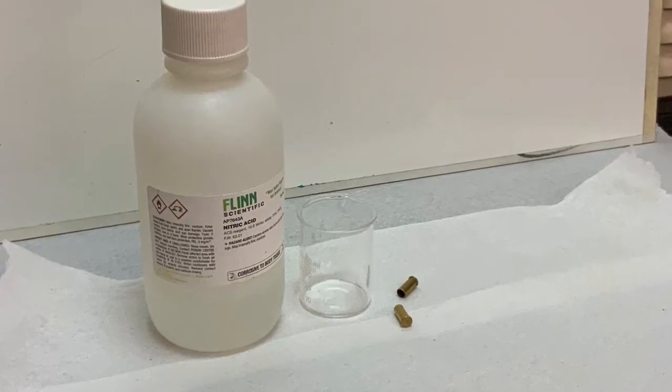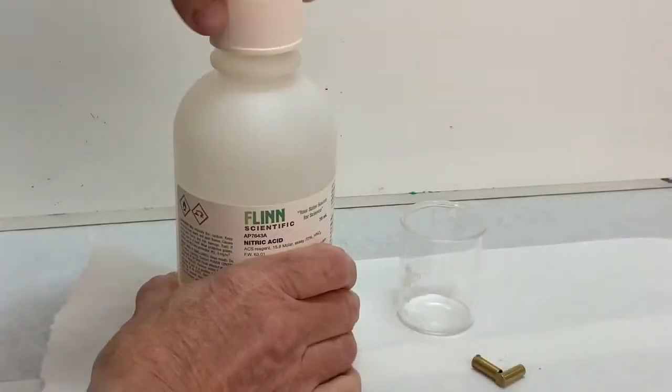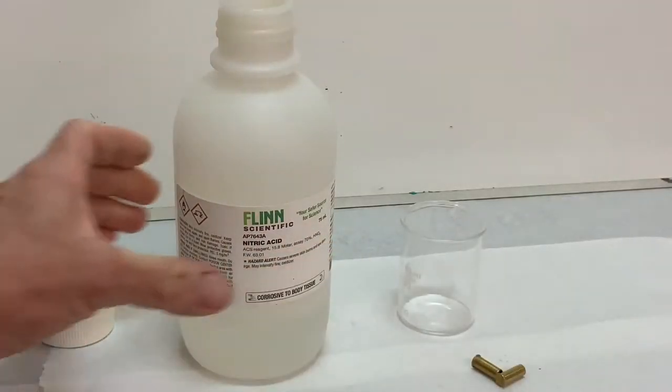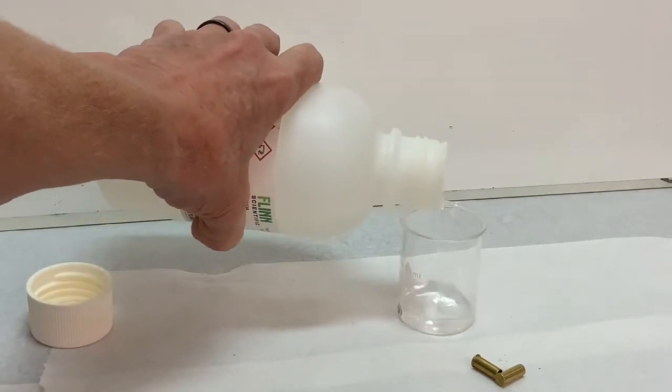In this reaction, we'll use concentrated 15.8 molar nitric acid, and the nitric acid will be excess, so I won't actually measure an exact quantity, we'll just eyeball it.